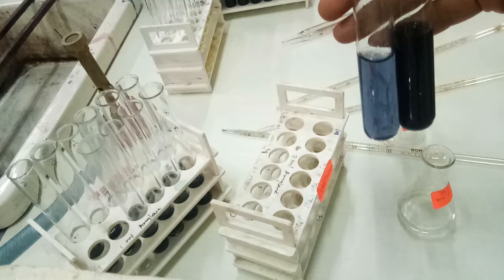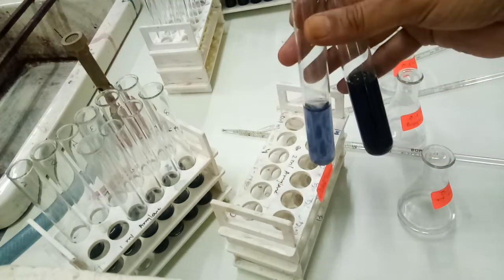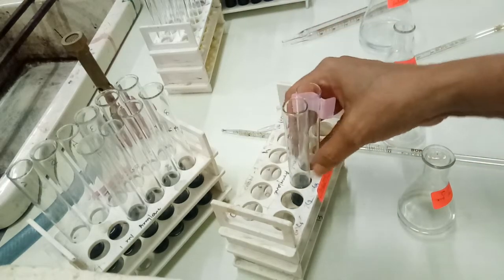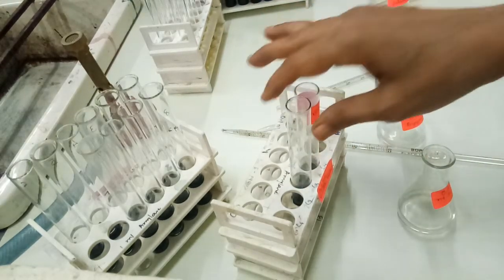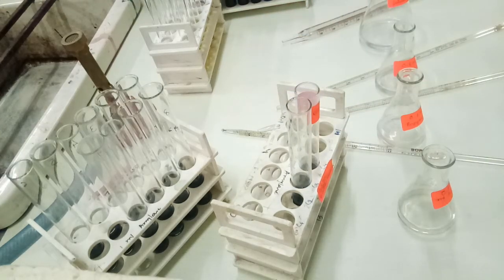So here we can see that in case of a higher amount of enzyme, the dextrinization is done in the very first minute. That is not even a single second; this was the immediate reading, that is the 0 hour reading. You can see that dextrinization is done. So what does it indicate? It indicates that now onwards the starch molecules are not available in the reaction mixture. So if you go on adding enzyme molecules, there won't be any change in the rate of reaction.